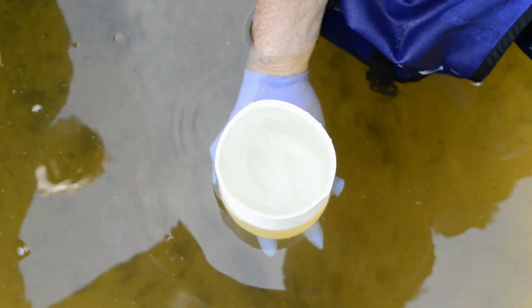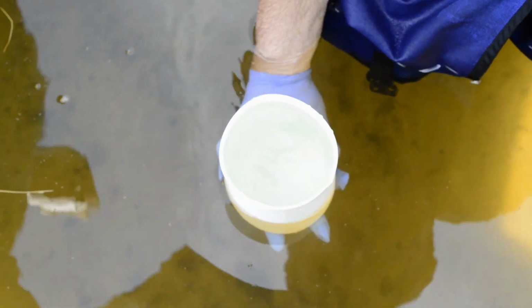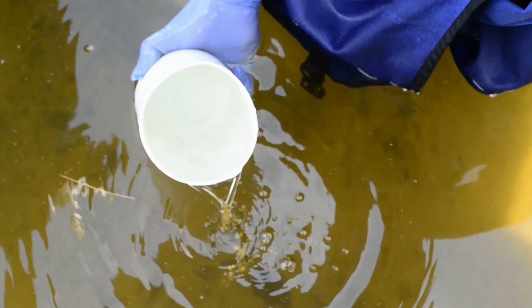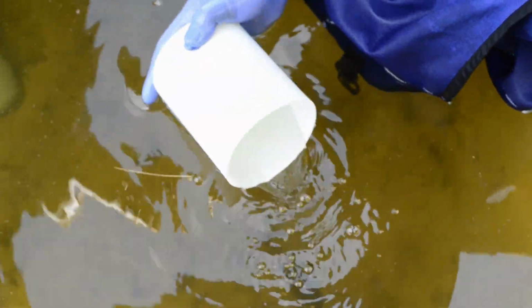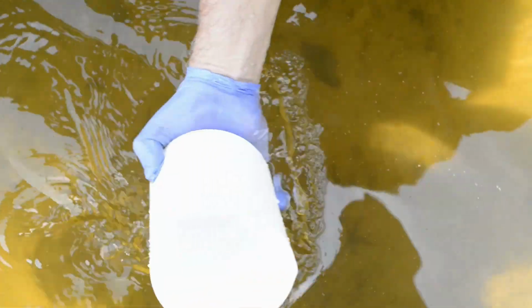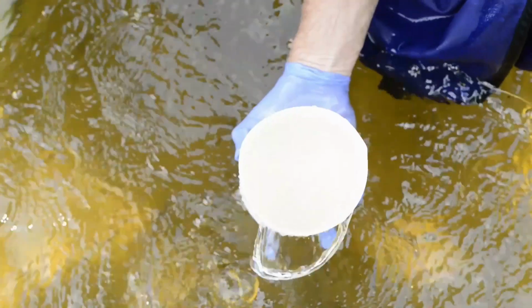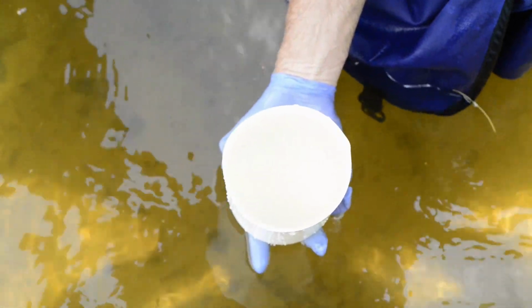The important thing is to get a sample of actually the clean water without grabbing stuff off the top. So there's the stuff that's clean. You can see it pouring out. It's very, very clean. And if we go back and just do like sweeping the unit, clearing the top, submerging, up through the bubble, you can see that difference, major difference.